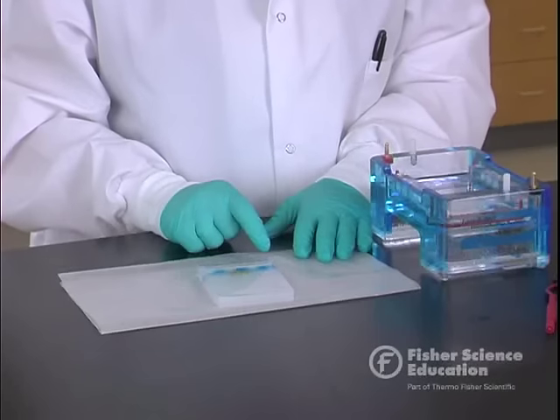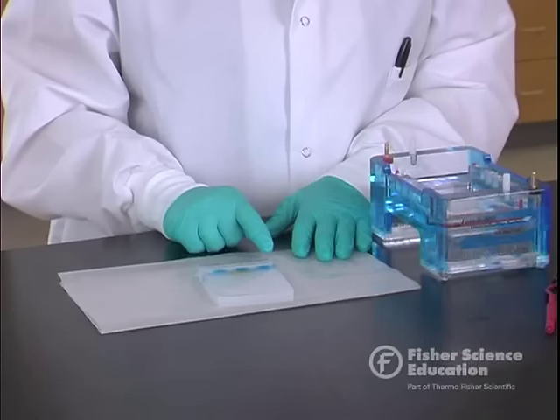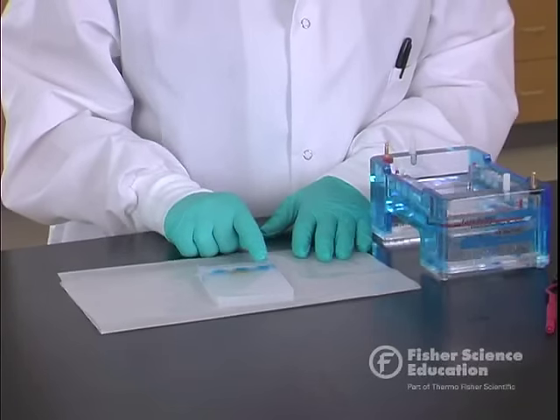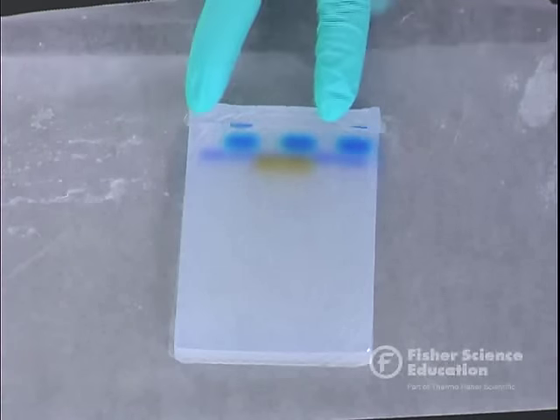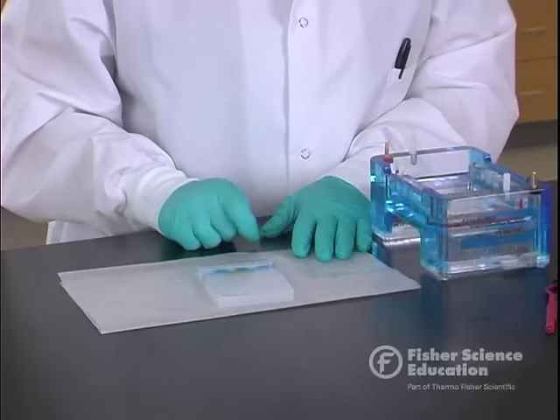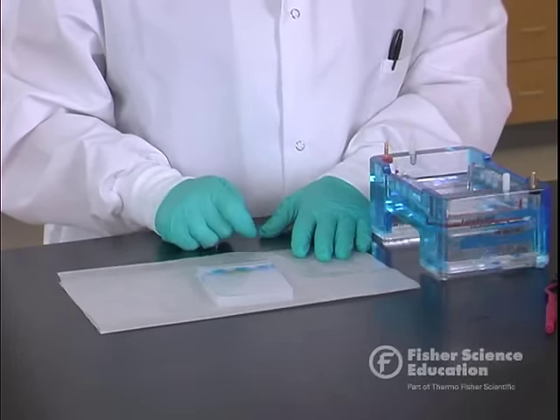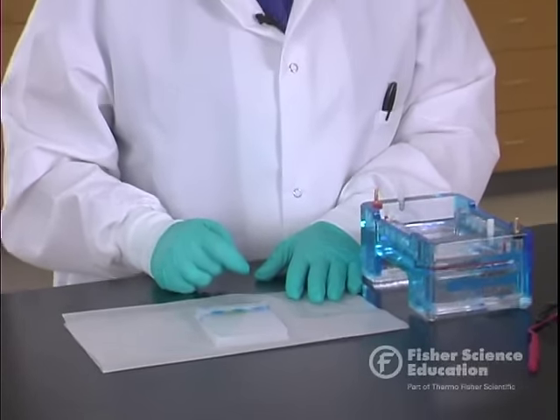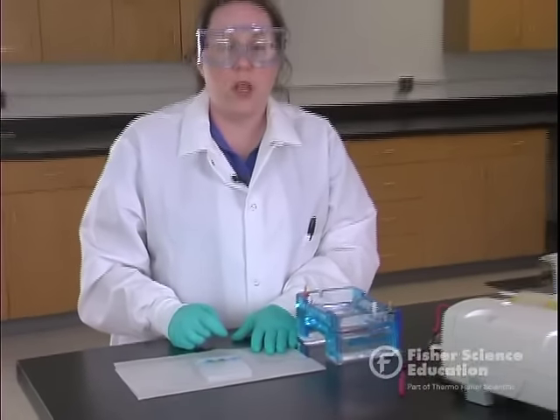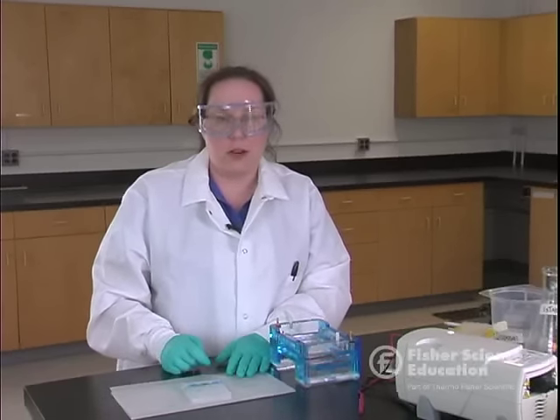This is also a unique example where we have a set of identical twins — we actually have two matching sets of bands on this gel. So there's a crime scene and a matching suspect, but then there's another set of matching bands with a single purple band. This is a great way to add a question to your labs where traditionally students just compare to the crime scene. Here we've thrown in a twist with identical twins for students to think about why there might be a matching set of bands.